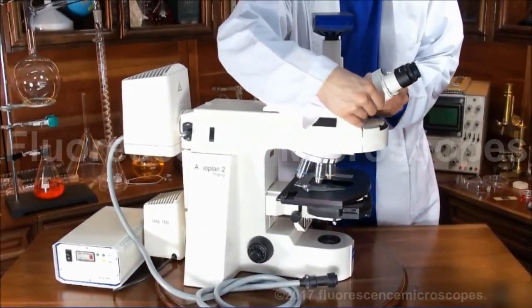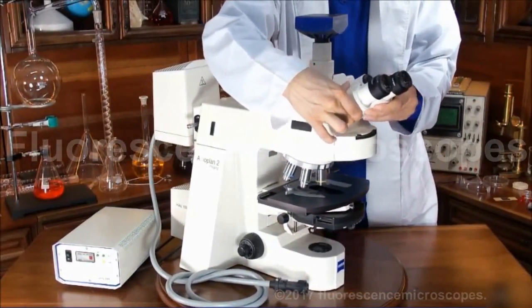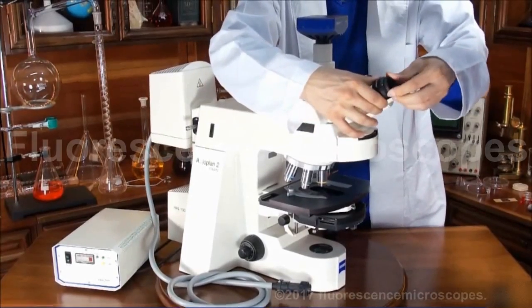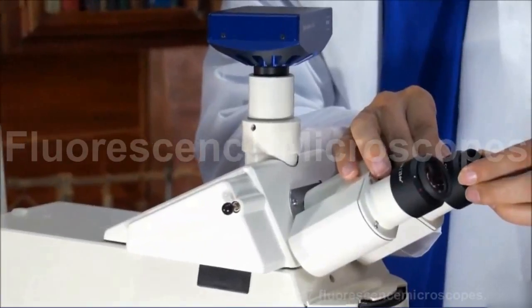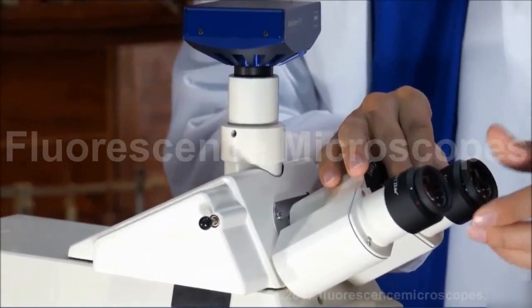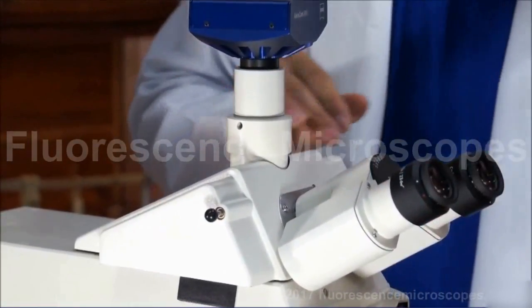Remember, you can adjust your interpupillary distance as well as your diopters. Each person may have a little different optimal diopter adjustment.